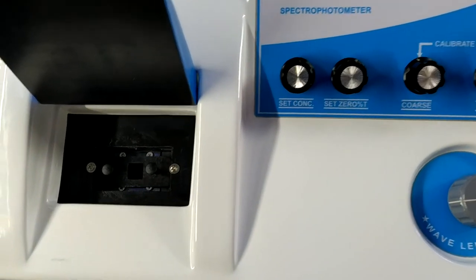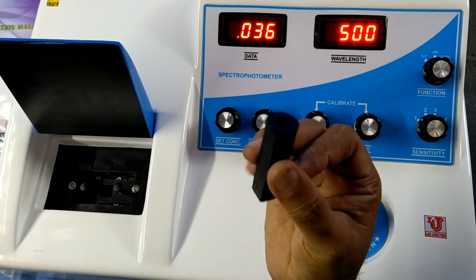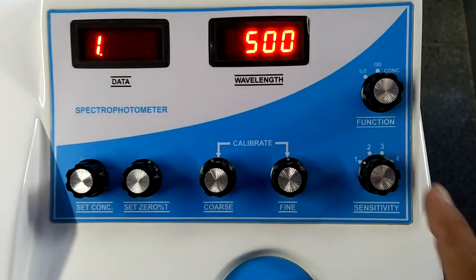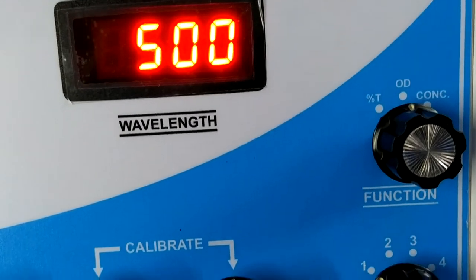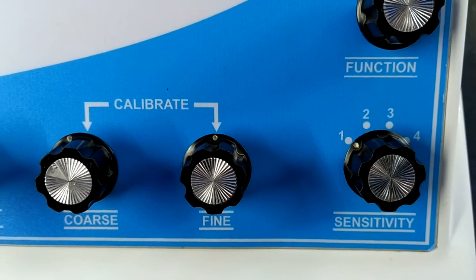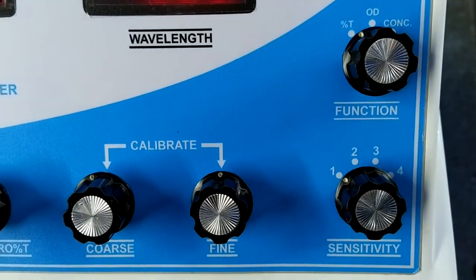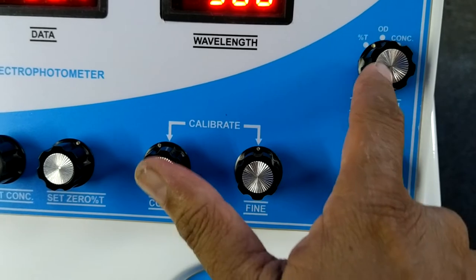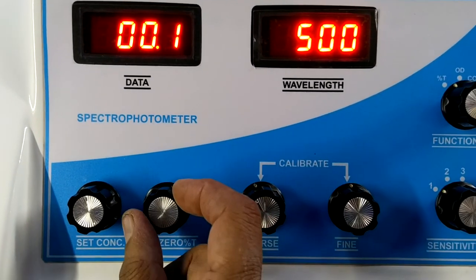First, you set preset zero with this dummy — dark current or black body. In the function control, three controls are there: Percentage Transmission, OD (optical density), and Concentration. There are four sensitivities. I am placing it to sensitivity 1. First, set from the function control to Percentage Transmission. On Percentage T, you set preset zero from the Set Zero knob.